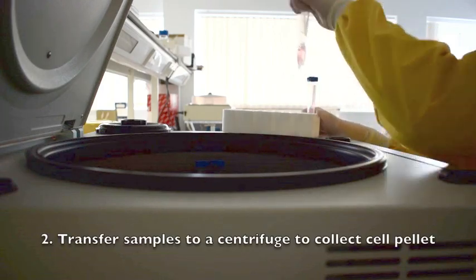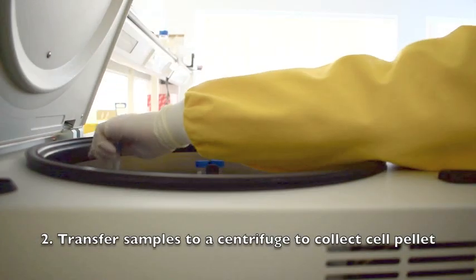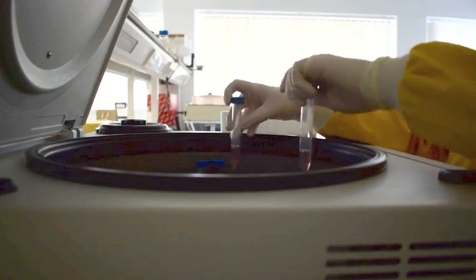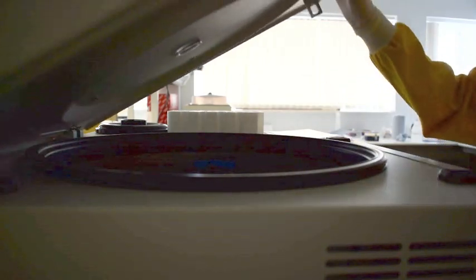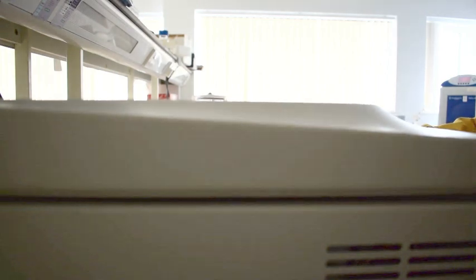Cultures are then transferred to a centrifuge in order to collect the cell pellet. Cultures are centrifuged at 154 RCF for five minutes.